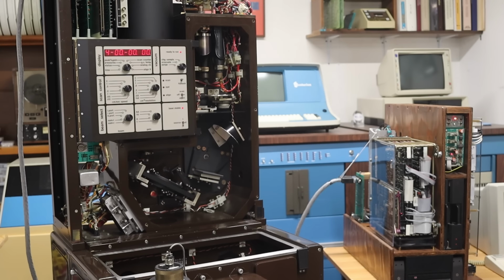The spectrometer didn't do anything. I don't know what I'm doing. I think this is gonna take maybe a couple of phone calls and a lot of reading. And I'll get back to you guys once I have a clue what's going on here.